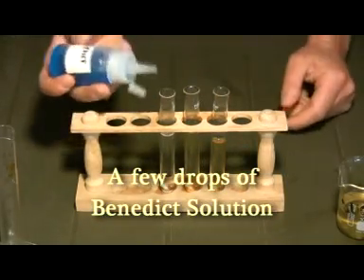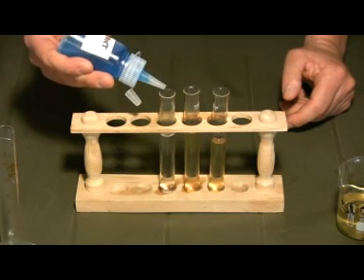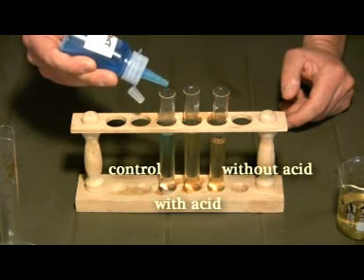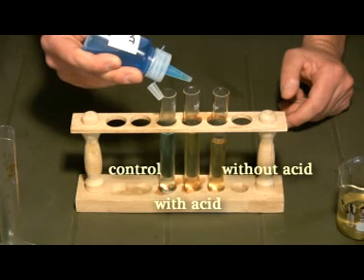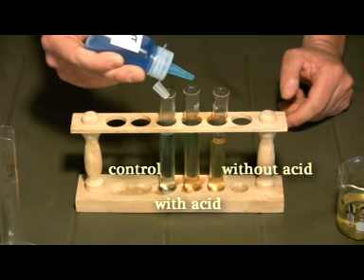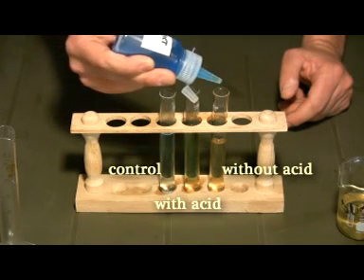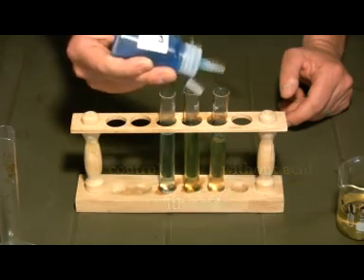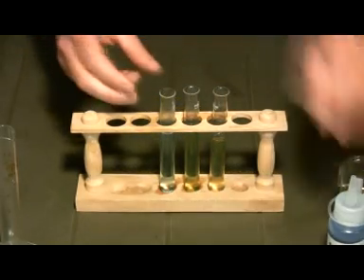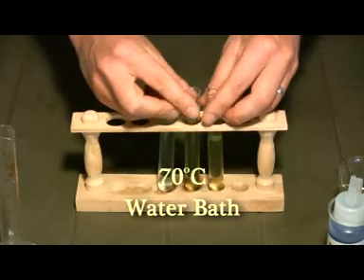Now it's time to add the Benedict solution. Add a few drops in each test tube. And we take those test tubes and put them in the water bath for a few minutes.